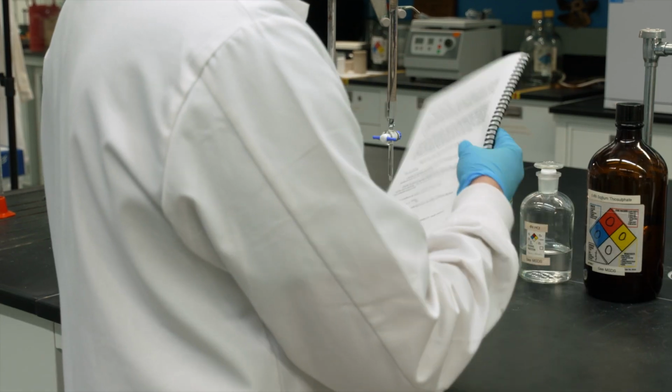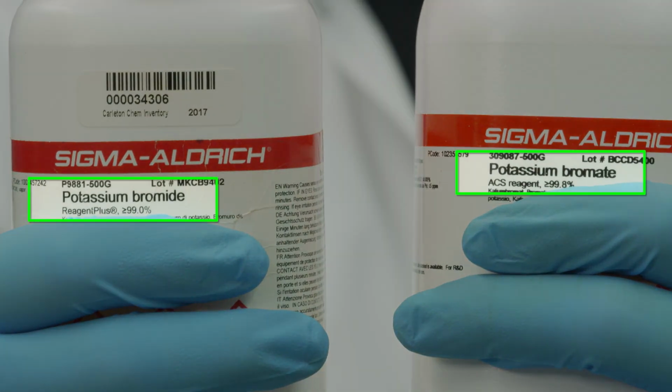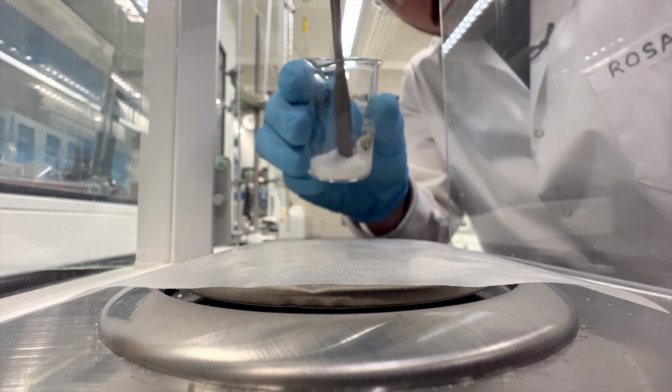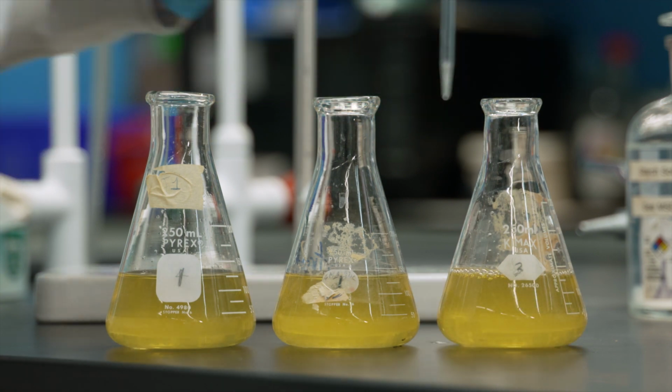When preparing solutions, make sure you carefully read the lab manual and compound labels. Many compound labels have similar names, but are very different. Adding the wrong chemical will set you back or give you unusable data for your post-lab report. Additionally, prepare all your solutions you'll be titrating at once to save time.